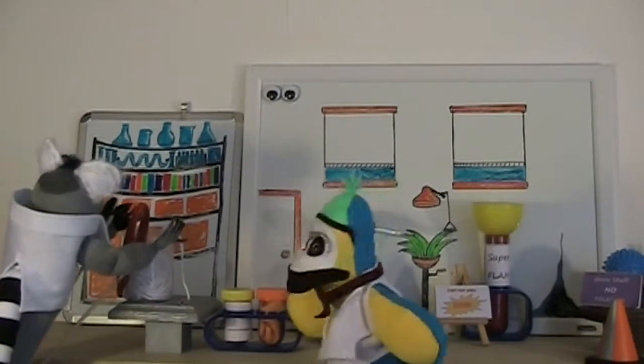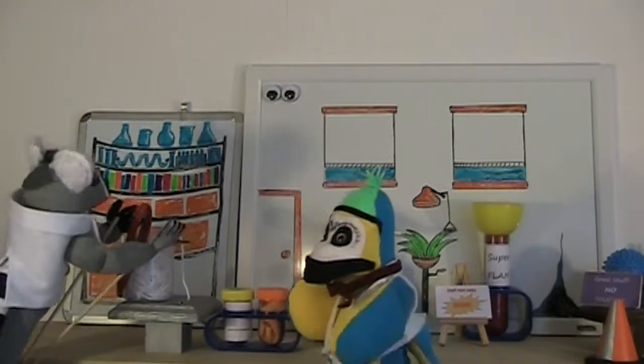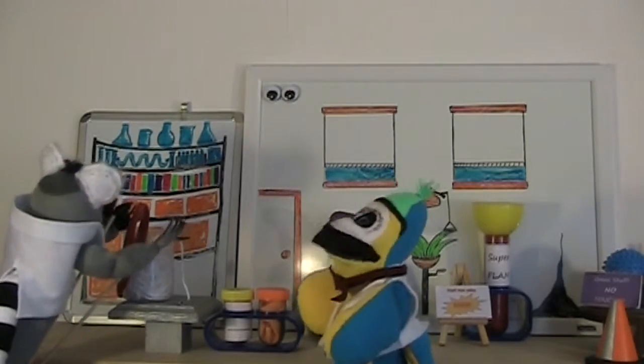Hey, Lemmy, there's going to be a safety inspection today. Oh, really? Will they want noodles? Depends on the kind of noodles. Ooh, those are really coming along.